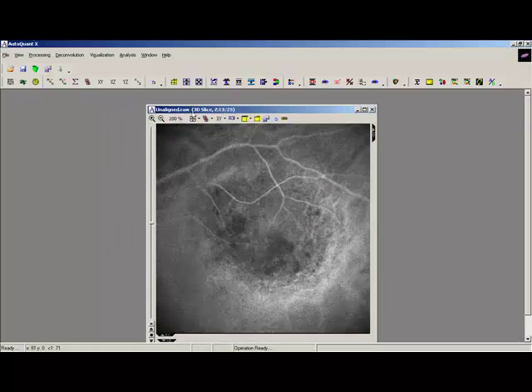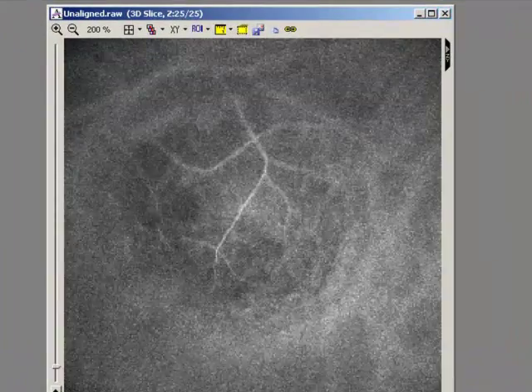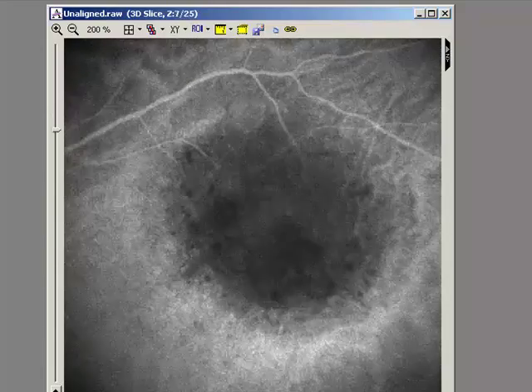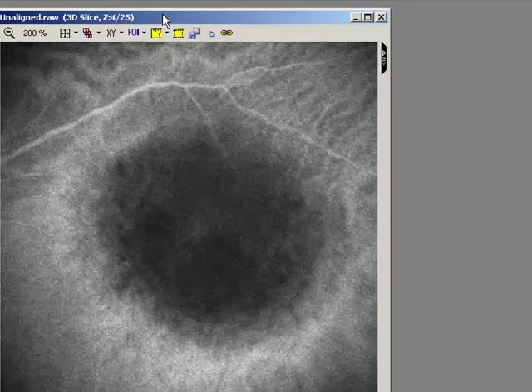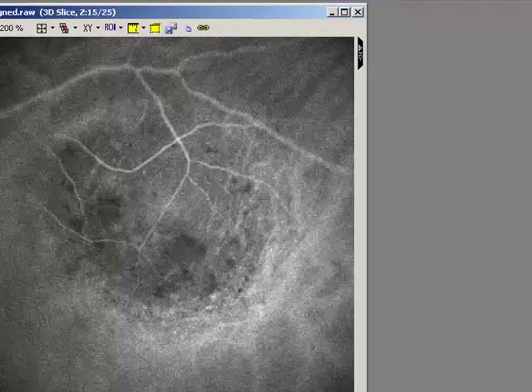So firstly, let's take a look at this image stack. I'm just going to play through it, the Z stack, and we can see here that it's really jumping around, it's all over the place. So I'm actually going to show you how to perform a slice to slice alignment here, and that basically is going to correct for XY movement between slices in the Z direction. So these slices which are jumping around should appear relatively stable.